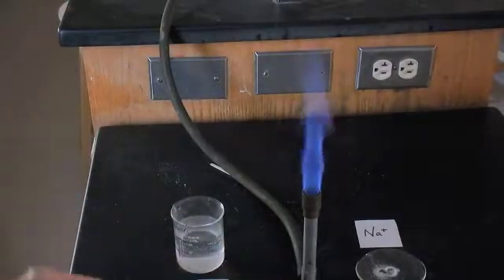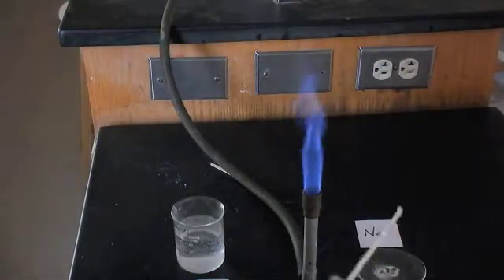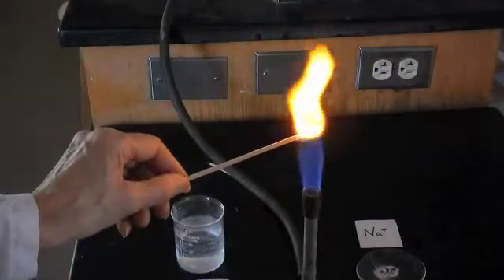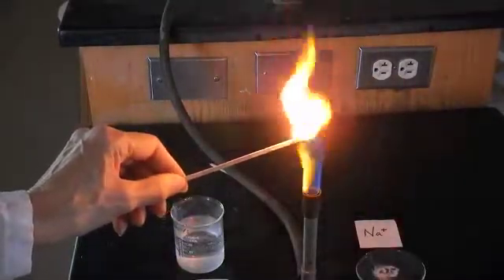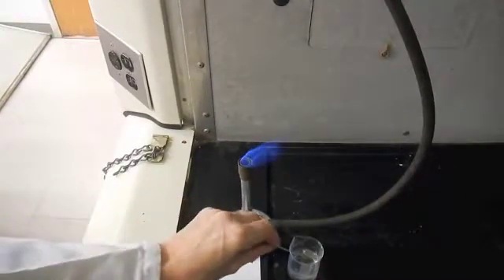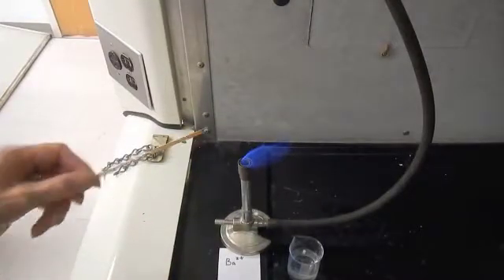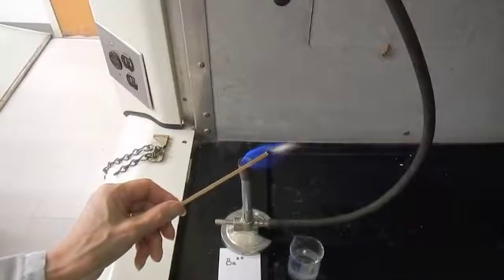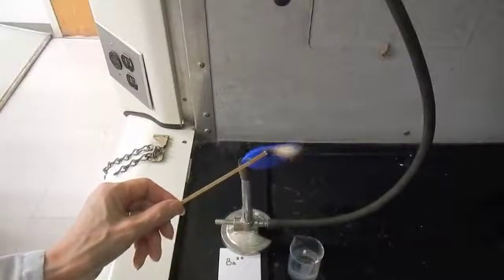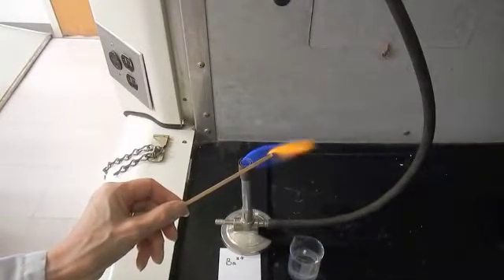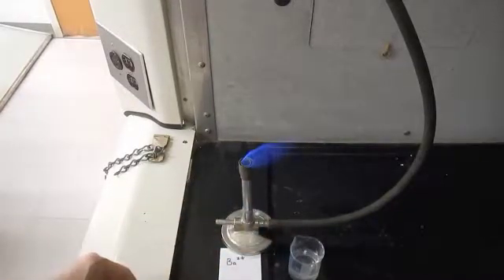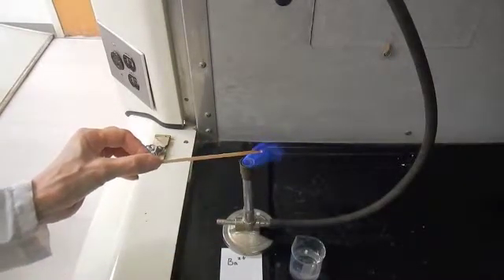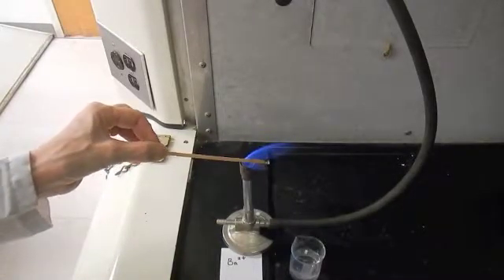Again, new taper. Recording that color very carefully. The next one we're going to do is barium—we're going to do it in a fume hood so you don't really want to do it in an open lab. Look really carefully. I think if I look once or twice I can see—we can't say the color that we expect because you have to write down what you see. We'll do this one a couple of times just so you can look carefully at what color you might see. The flames are really very blue there.